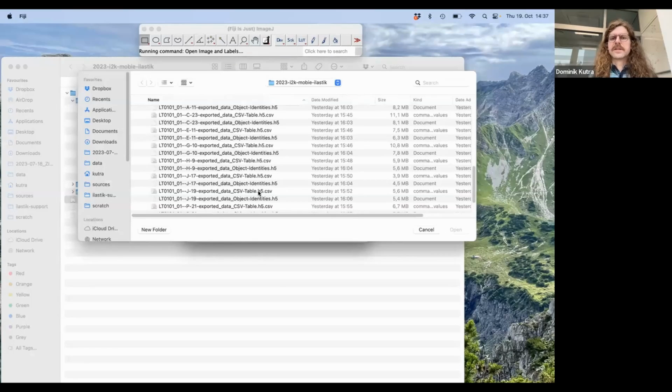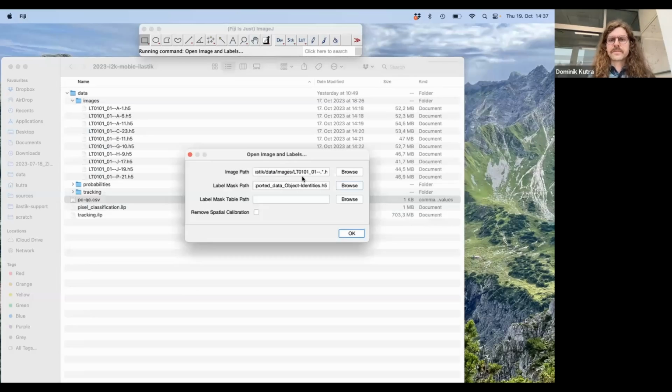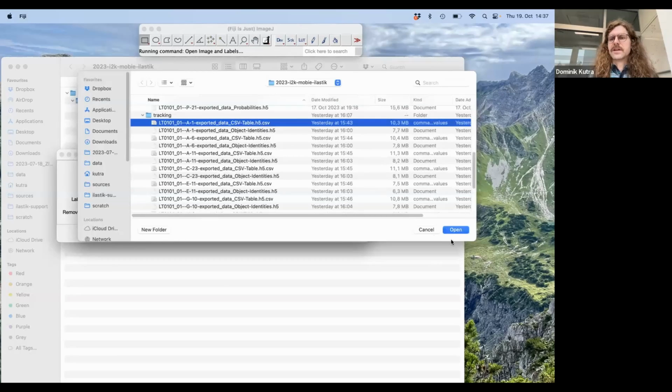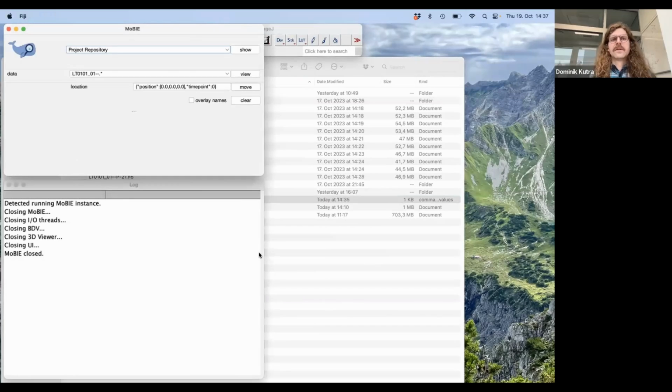In Ilastik, these are called object identities. But that is in the end just a label image. So I take one of these object identities, and again, I replace the varying part by dot star. And I do then the same for the table. And the nice thing is that you don't have to jump through too many hoops, as you have seen before, where you have to rename or specify columns. This is already supported by MoBIE for Ilastik tables from tracking. Okay, so if I press OK now, MoBIE should start up.